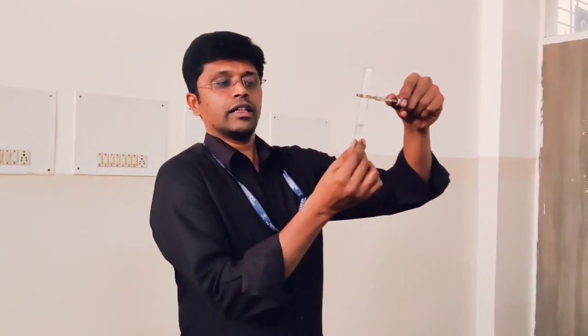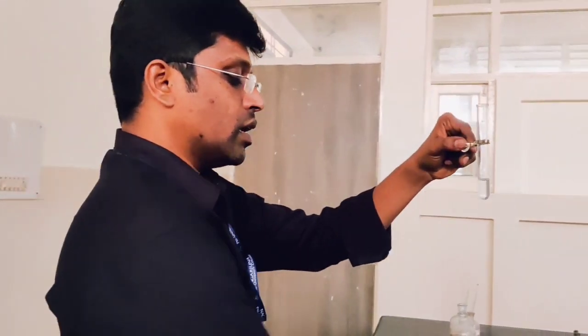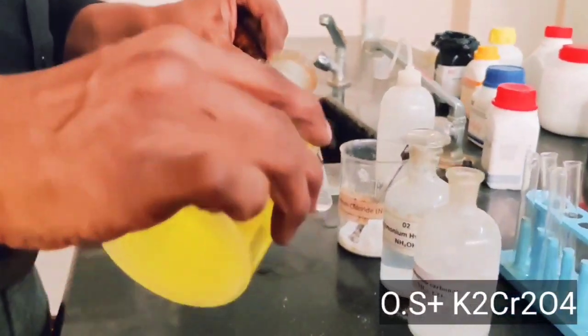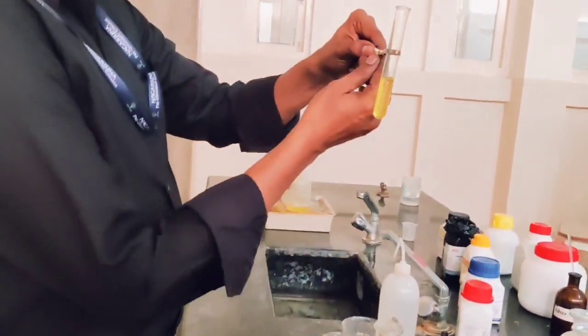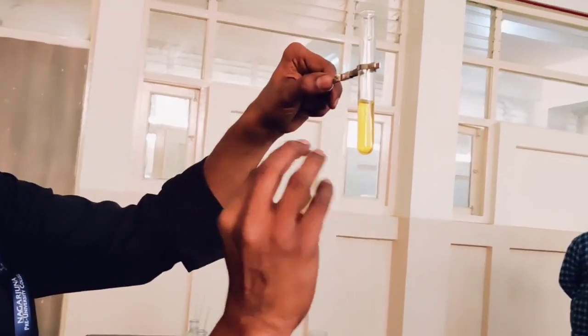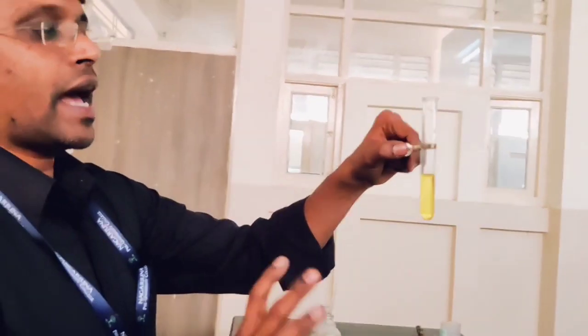We have to analyze in order, so we test barium first. We have taken the original solution and add potassium chromate solution to test for barium. We do not notice any precipitate — only a yellow solution — which shows that barium is absent.